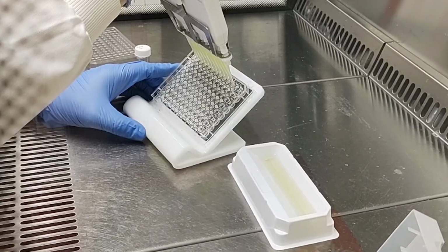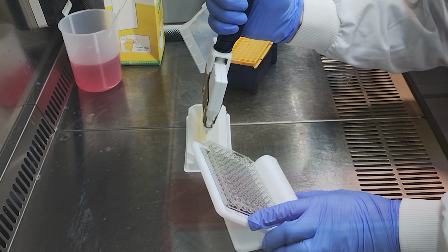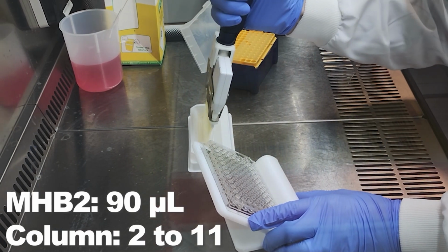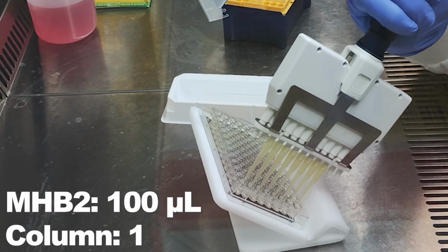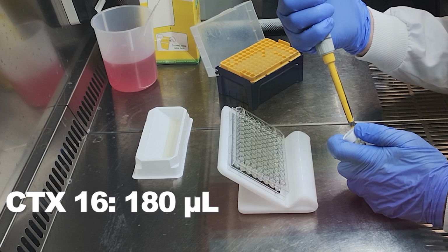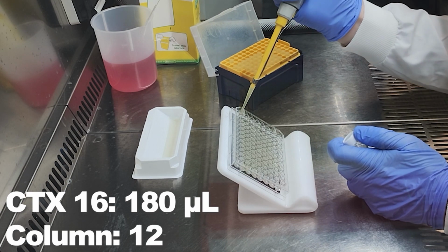Okay, now let's set up the plate. Add 90 microlitres of broth to columns 2 to 11 and 100 microlitres to column 1. Now we can add 180 microlitres of our antibiotic solution to column 12.